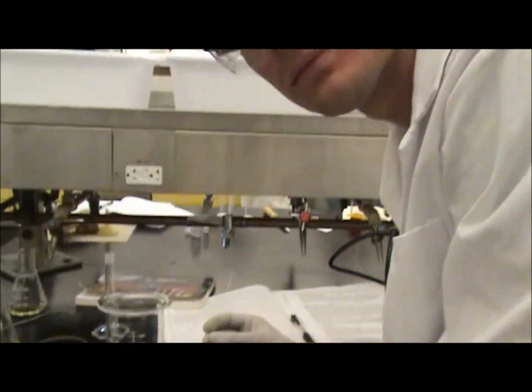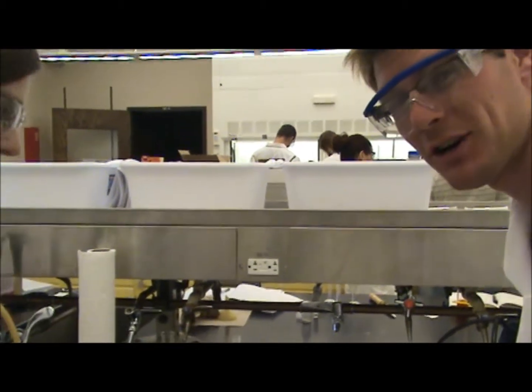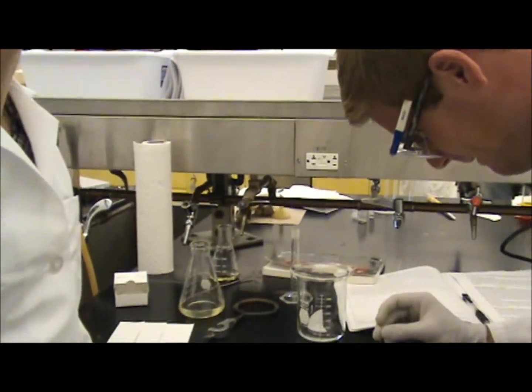And why are you doing this? To figure out our solvent ratio. For the column, right? For the column chromatography. Awesome. This is for the alpha carboline synthesis.